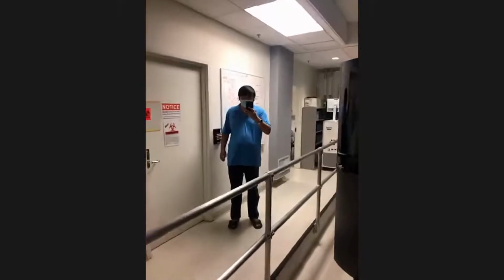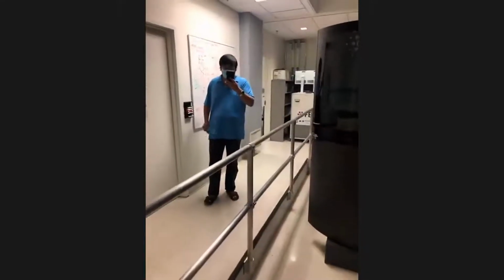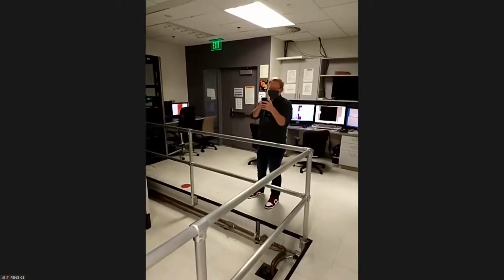So we will thank Peng real quick. I think he's looking at me with his camera. This is a great shot. And we're going to see him again in a minute. He's going to run upstairs to our new data center, just so that we can show you how we deal with all the data that's coming out of these new microscopes. So thanks, Peng. We'll see you in a couple minutes.